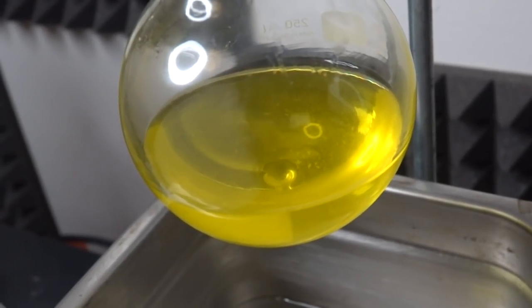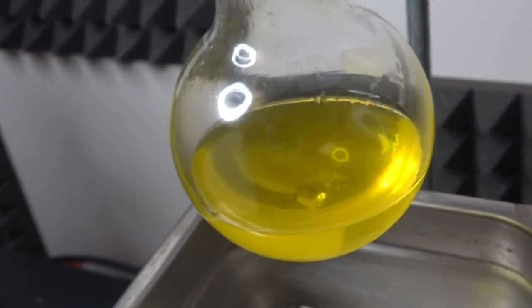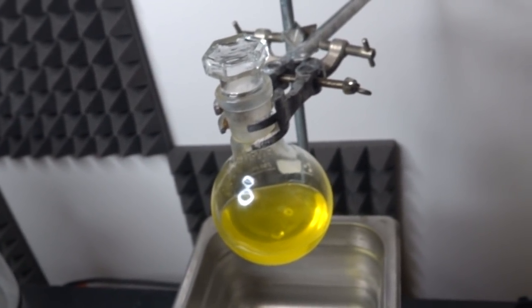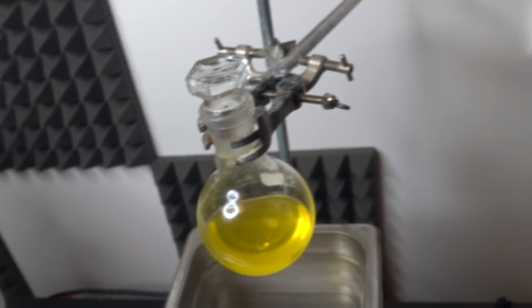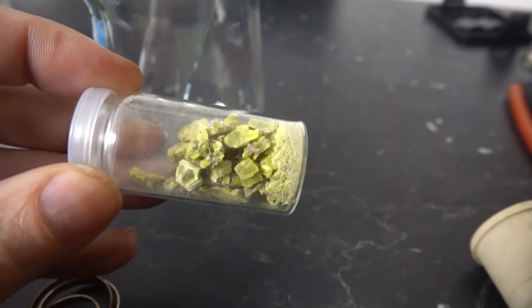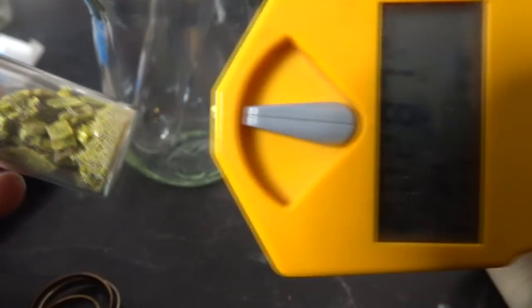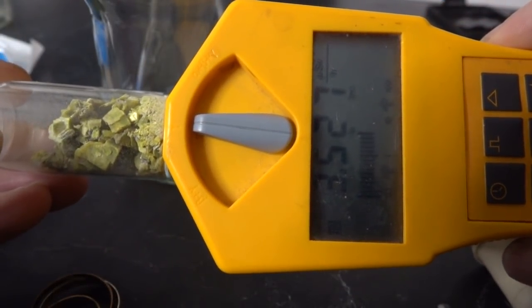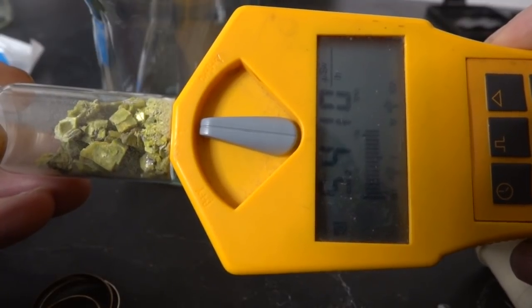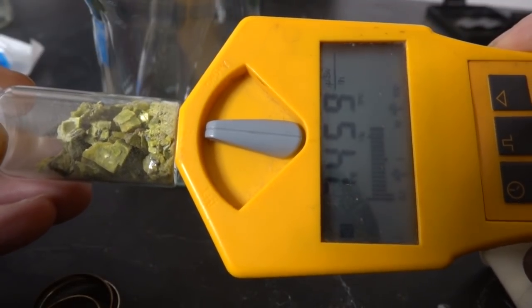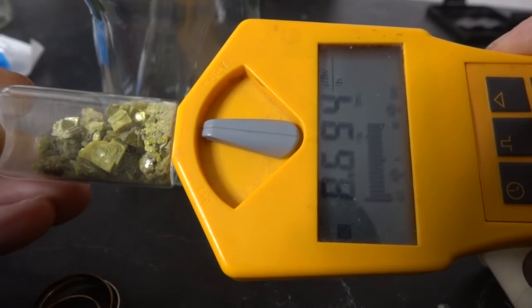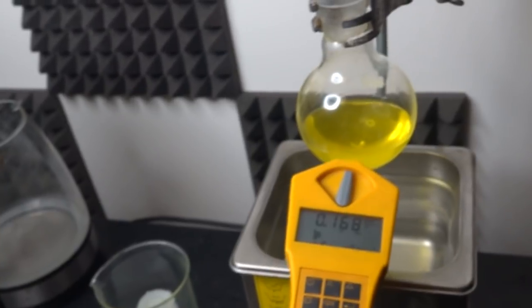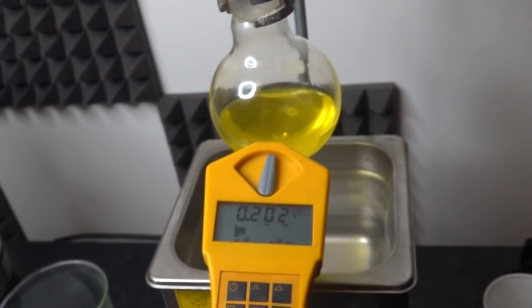So the bubbles there are coming from the hydrogen peroxide. That's what it looks like at the moment. And if you recall this was off the scale earlier. Uranium ore, just to show it is uranium ore. You'll find this goes up to, bear in mind about 0.1 is background, so this is like about 100 times background, that sort of thing, with about 0.1 being background.